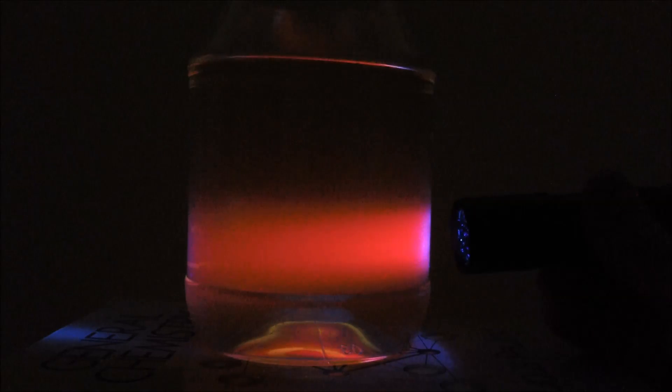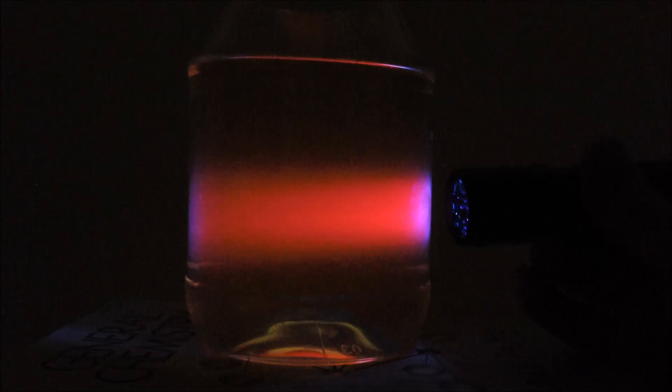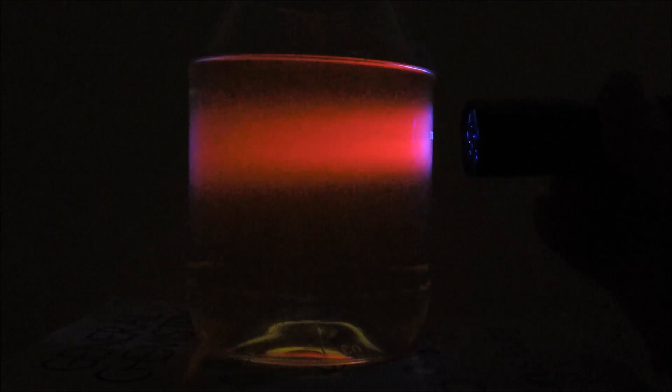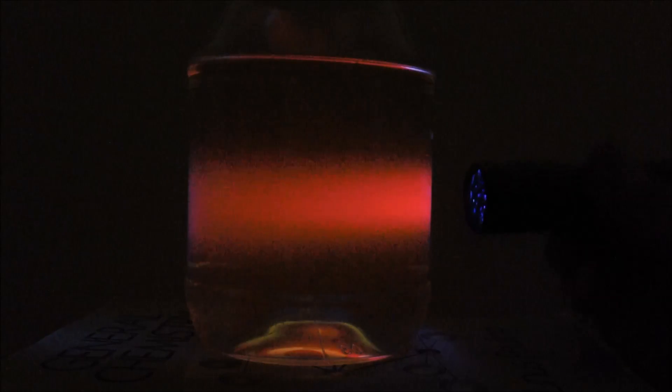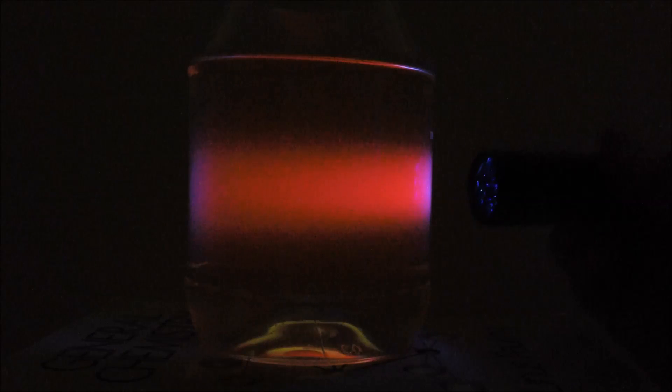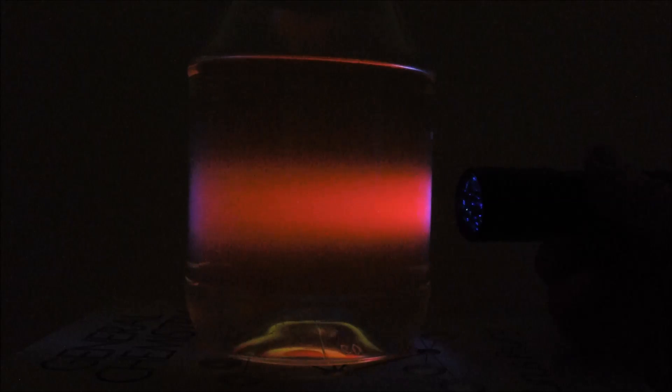I think you can see. It looks, unfortunately, kind of orange, but if you look at it straight on, not through the video, it's a red color. It's a beautiful red color. Unfortunately, the video gives it an orange color. I don't know why.